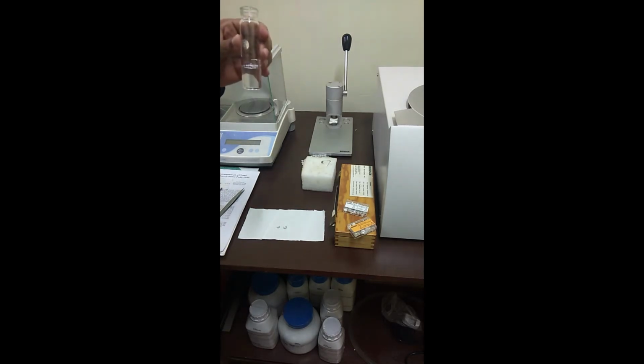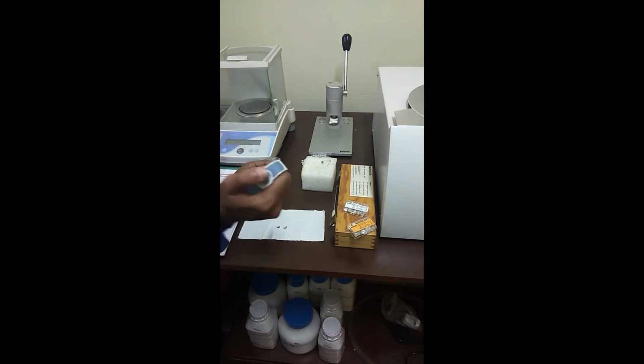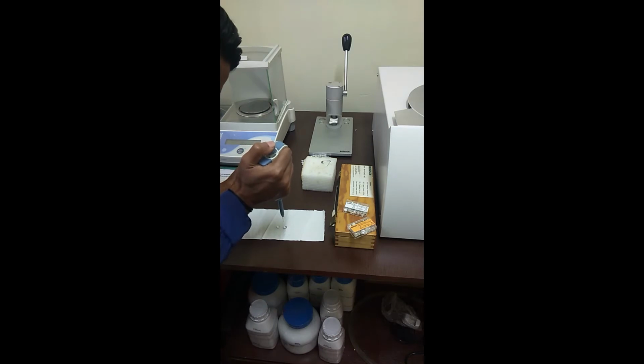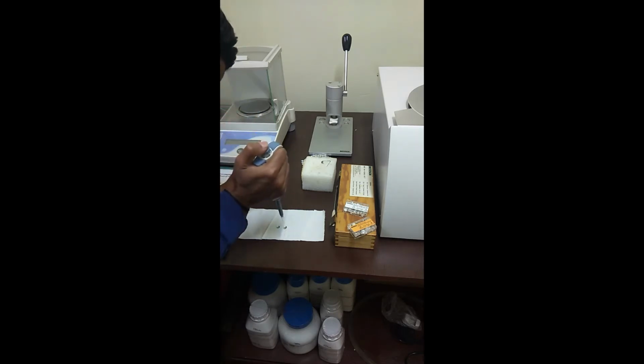The sample which we are loading, since our sample of interest is a salt solution, initially we'll load a control sample which is water. And let's now look how the sample is being loaded in the crucible. So we'll take a very small amount of the sample and we'll load it in the crucible. The advantage of DSC is that it requires a very low amount of the sample of your interest.